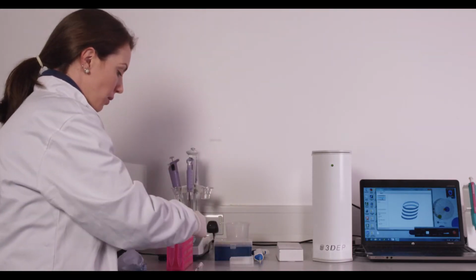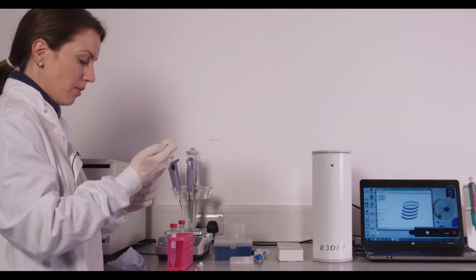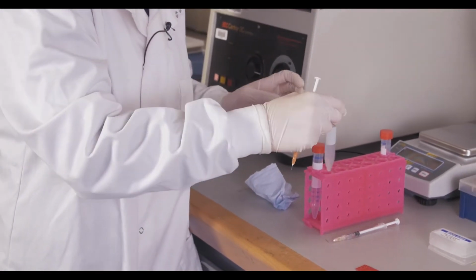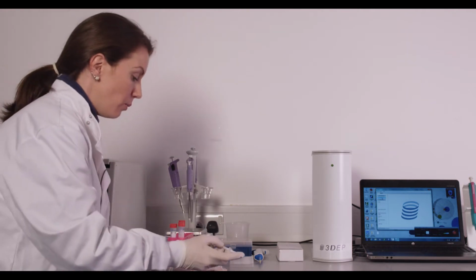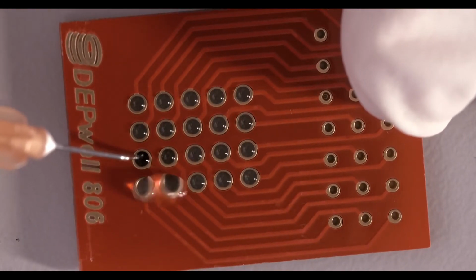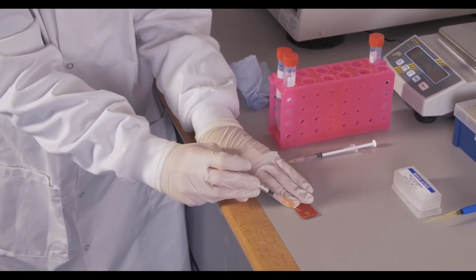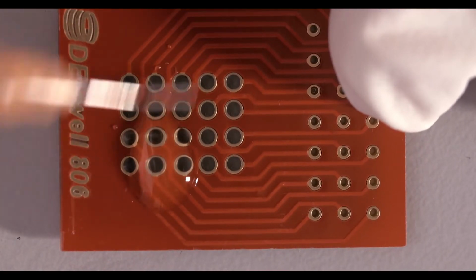So if you're using the needle, you'll simply take some of your cell sample and load your chip. Now again, this is completely up to personal preference. Some people like to leave the chip lying flat on the desk, in which case you'll come over top of the chip and in any well that you wish, pipette in your cell sample. And what you'll notice is you get this nice meniscus forming right on top. Now with the flat end of your needle, you can then wipe this across the chip.